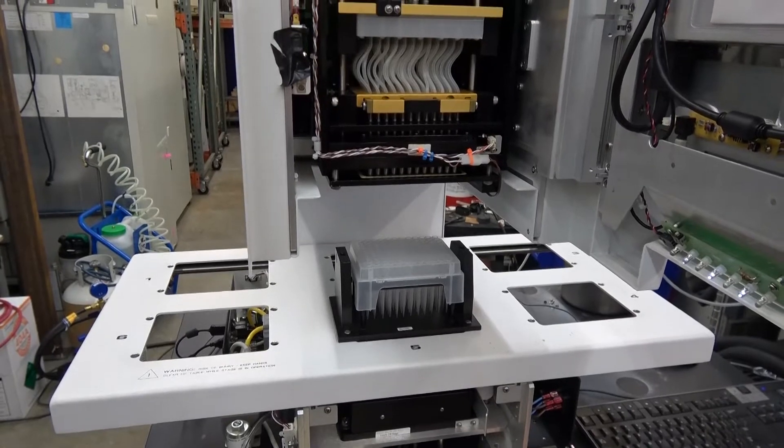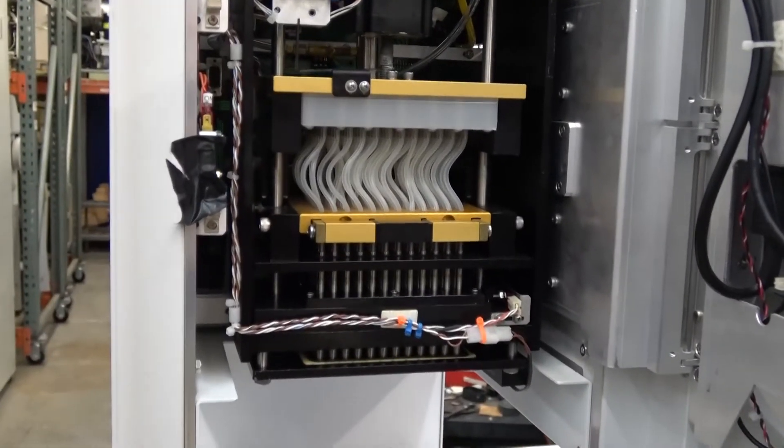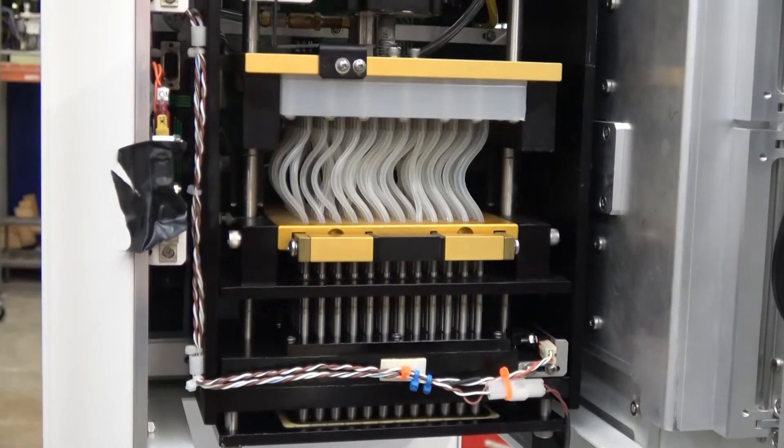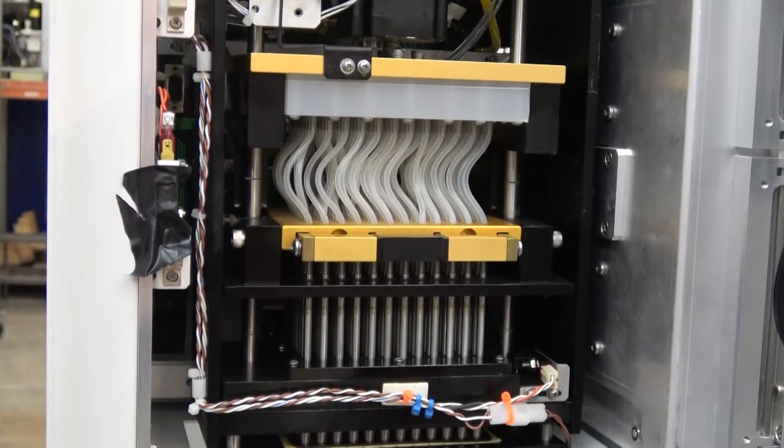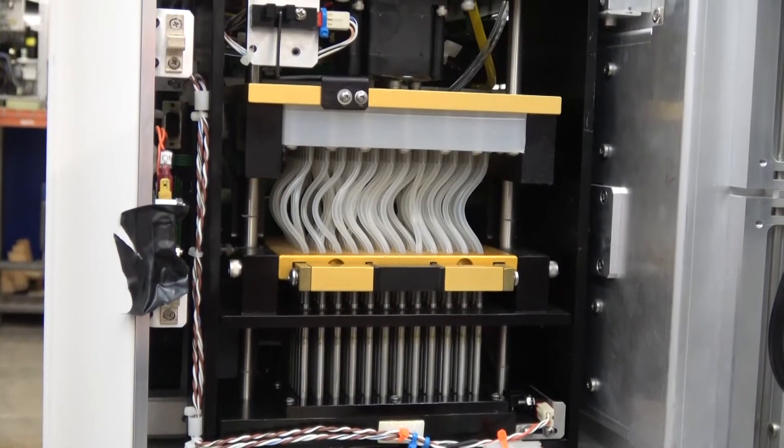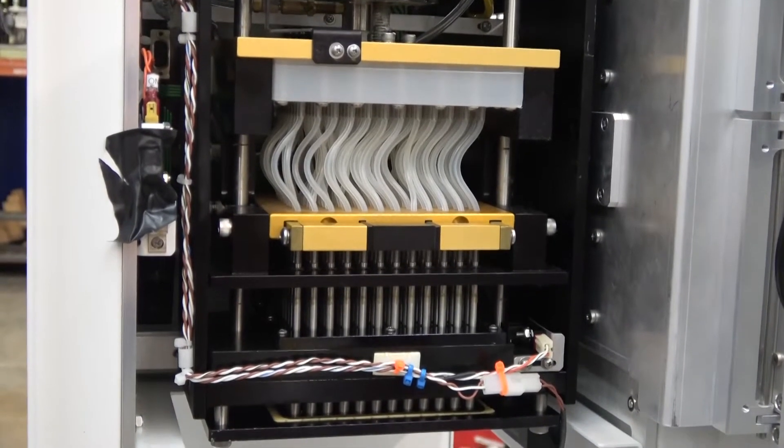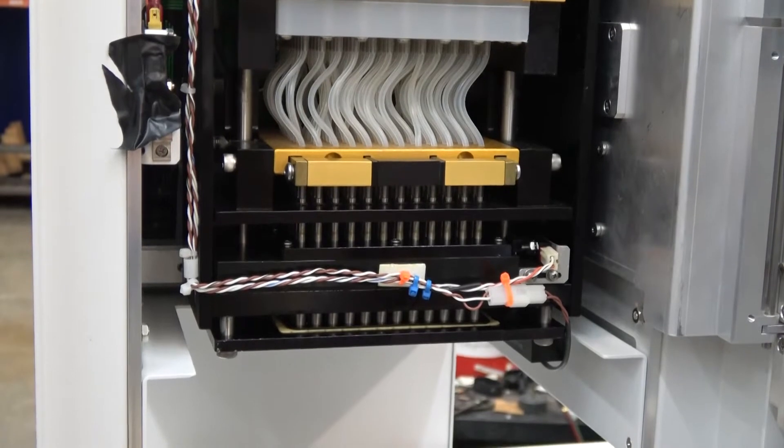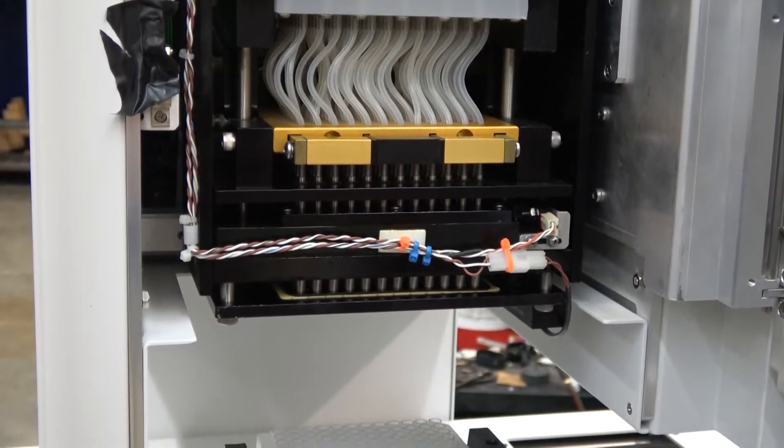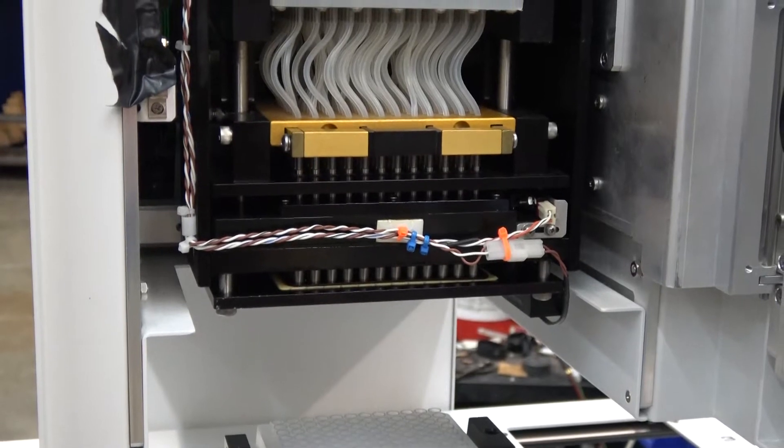Here pretty soon the pipetting head is going to move up and down. So first it aspirates, now it's going back down. It's now ejecting the fluid.